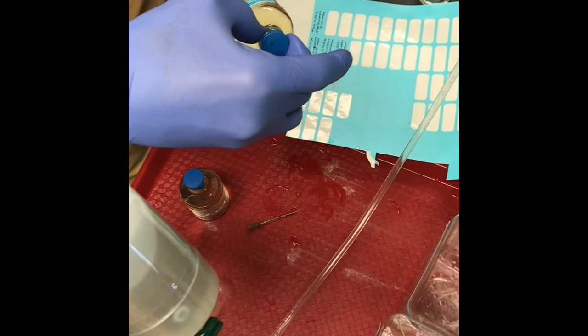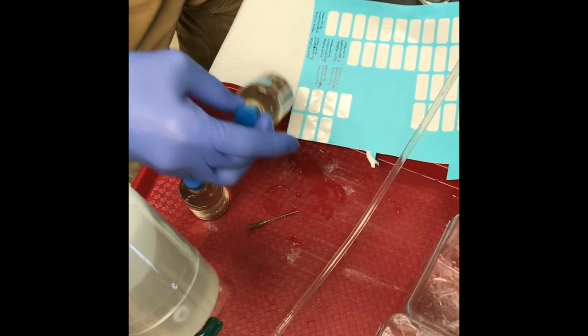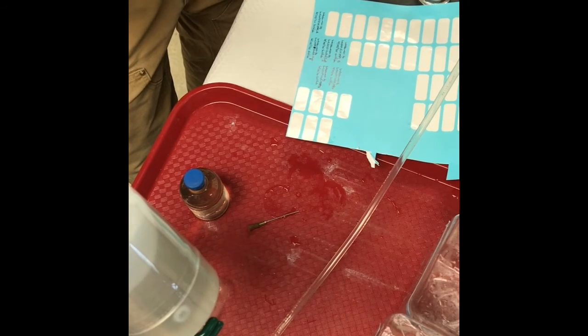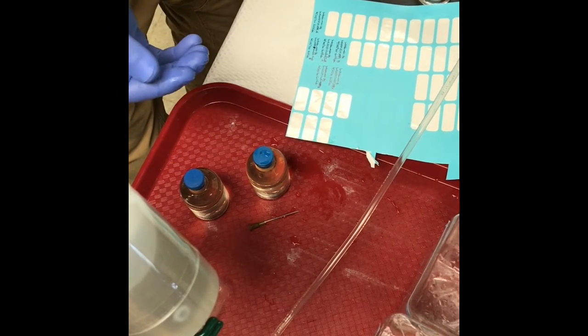Make sure I got the right sample—this is double SSD filtered influent. Just check to make sure there are no bubbles. I already preloaded the bottles with zinc, so it should be preserved in a stable way.